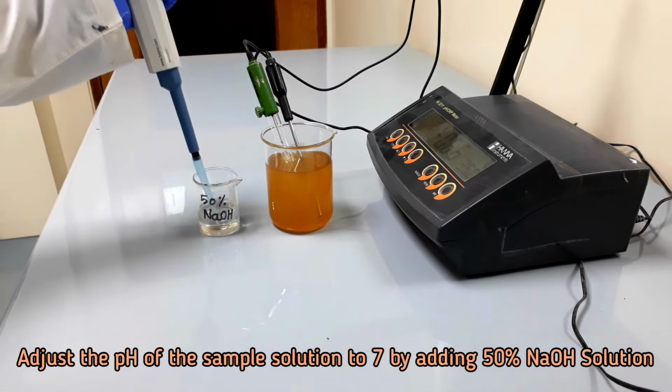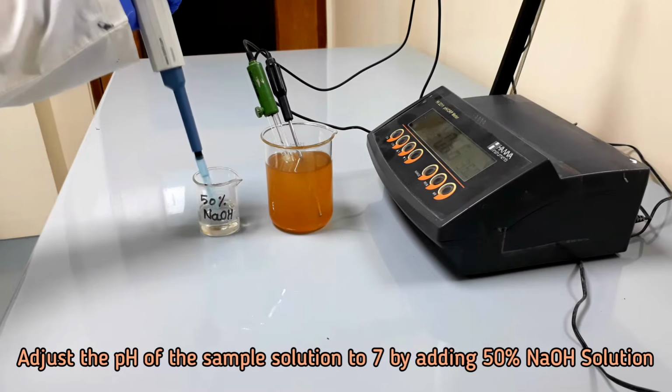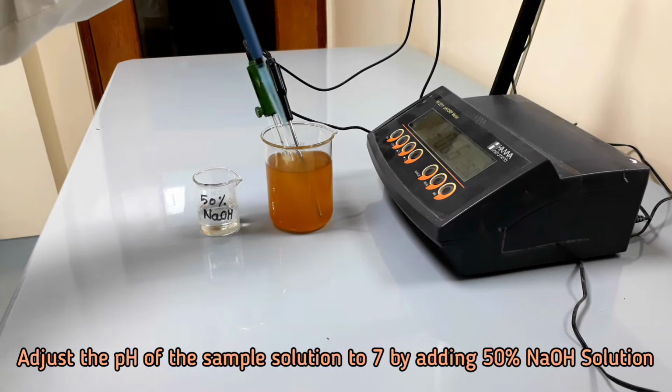Now adjust the pH of the sample solution to 7 by adding 50% sodium hydroxide solution.